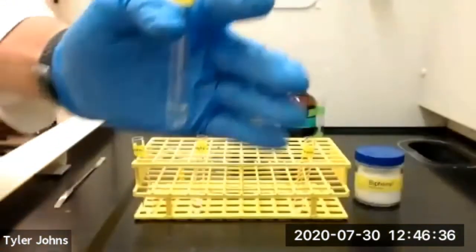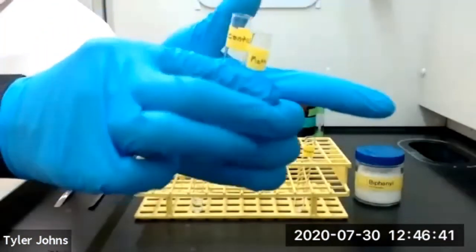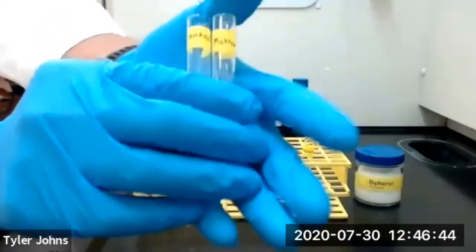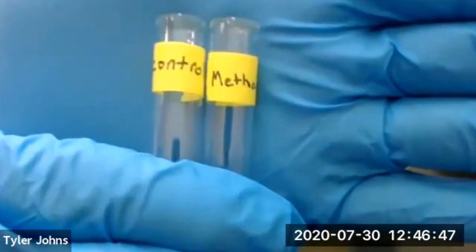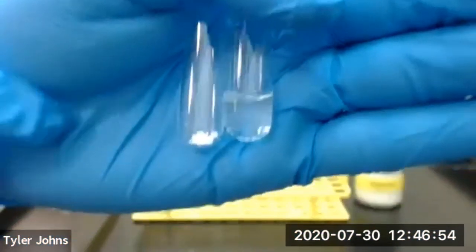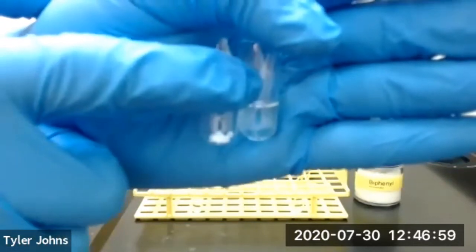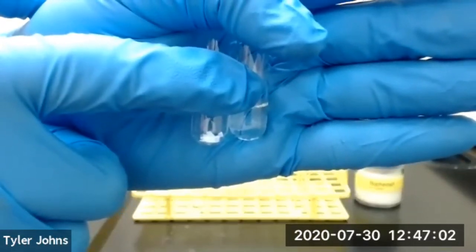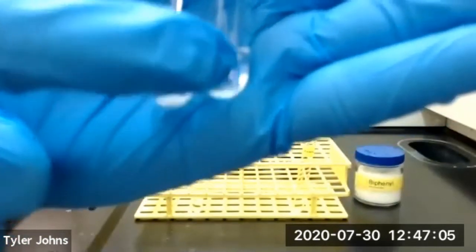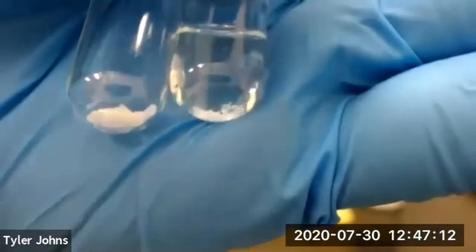So it's been about 60 seconds. So we'll remove our microspatula and we'll compare the amount of solid biphenyl remaining in our test tube with methanol compared to our control. So we have our control here and our test tube with the methanol and the biphenyl. And you can see that there is some solid biphenyl remaining in our test tube with the methanol.